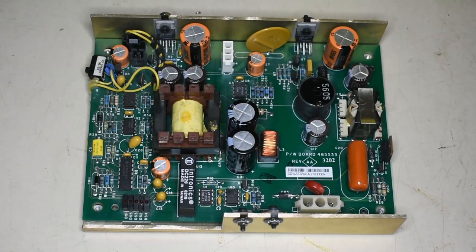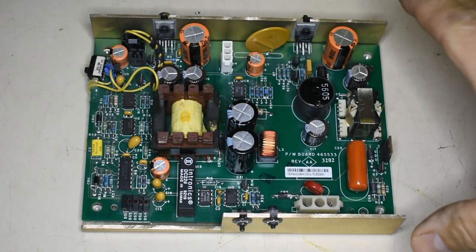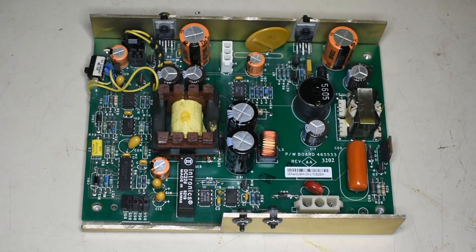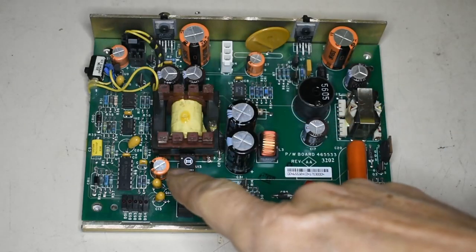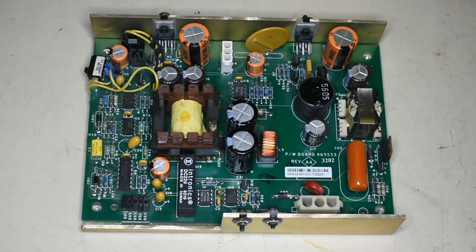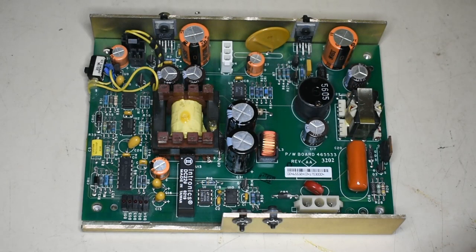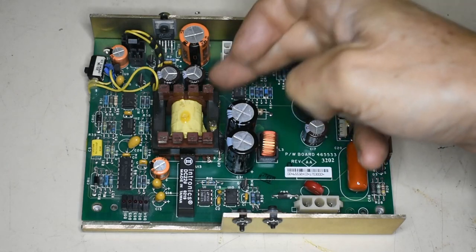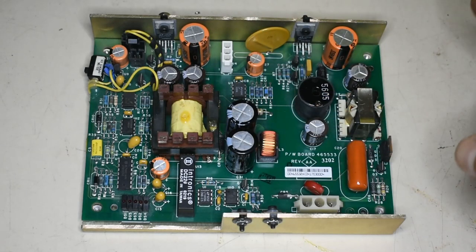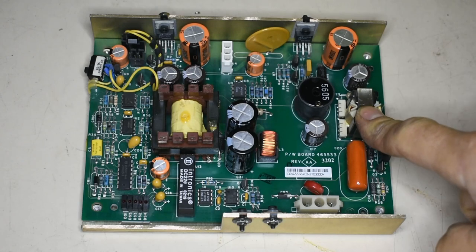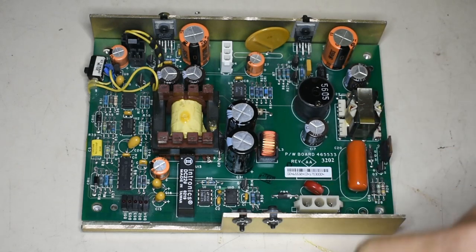This is a commercial ballast for a deuterium lamp. It runs off 24 volts DC and it has on board the inverter part here which generates the anode voltage to 100 odd volts and it's rectified and smoothed. It also has voltage generation for the pulse to start it. So the start transformer's here.